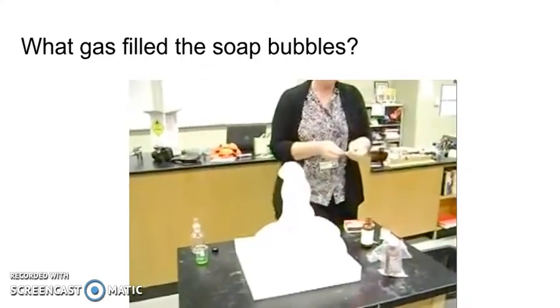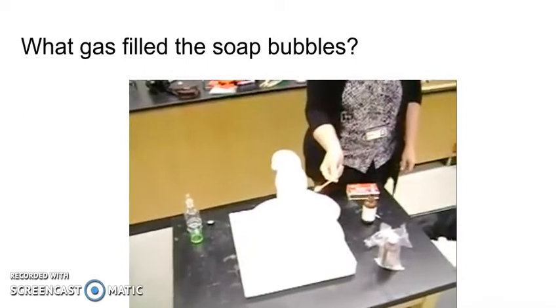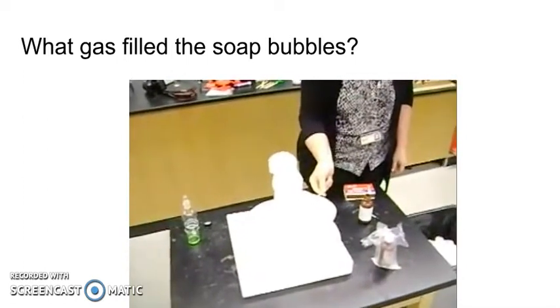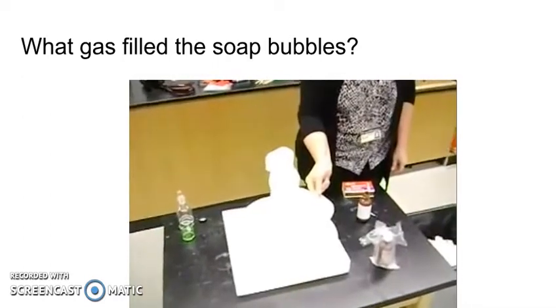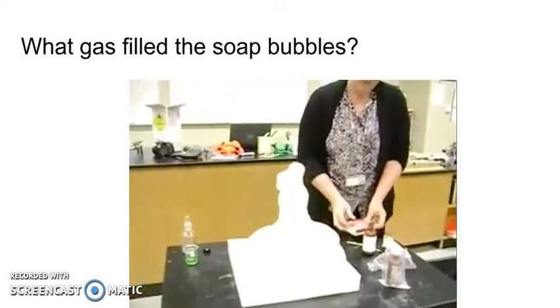I already know what's going to happen. Hydrogen explodes, but oxygen promotes burning. See how it glows every now and then? Because it's promoting the burning, then the soap gets in the way.